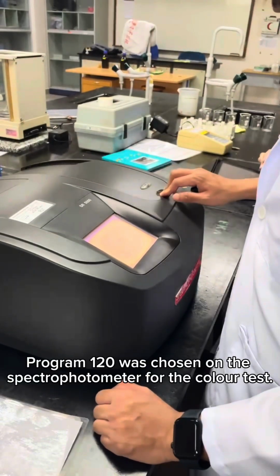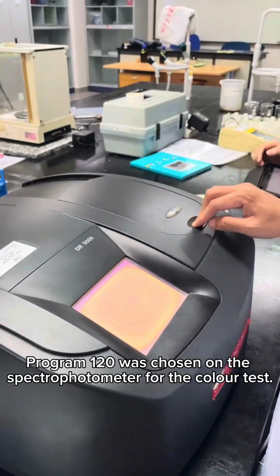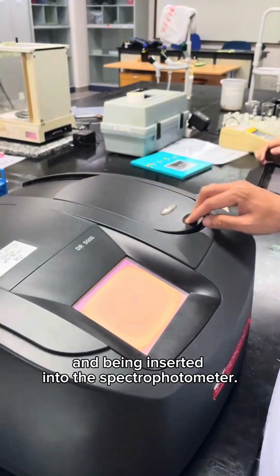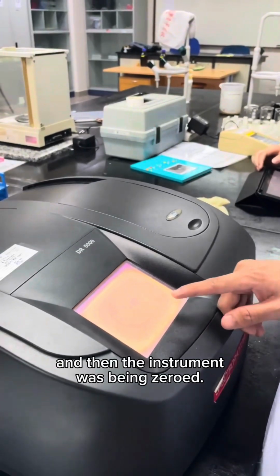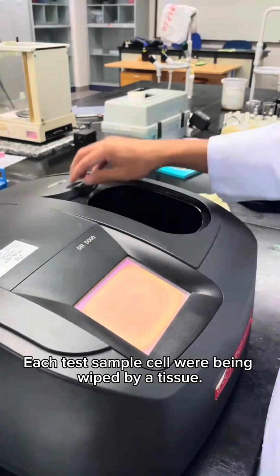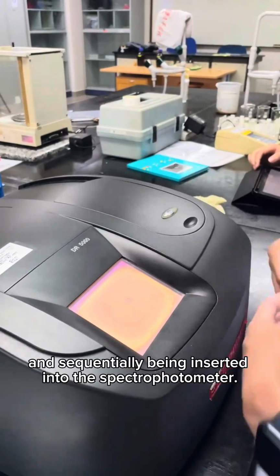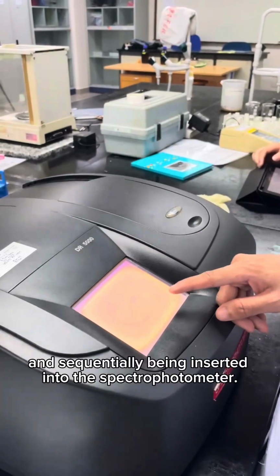Program 120 was chosen on the spectrophotometer for the color test. The blank sample was wiped with a tissue and inserted into the spectrophotometer, and then the instrument was zeroed. After that, the blank sample was removed. Each test sample cell was wiped with a tissue and sequentially inserted into the spectrophotometer.